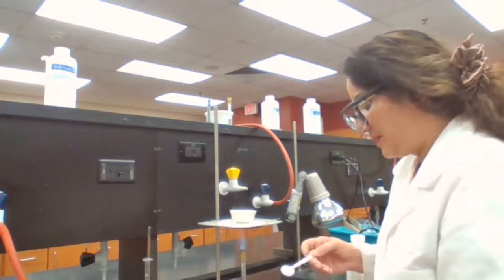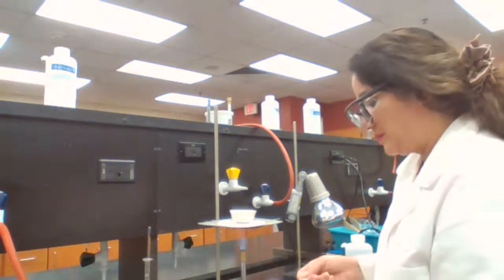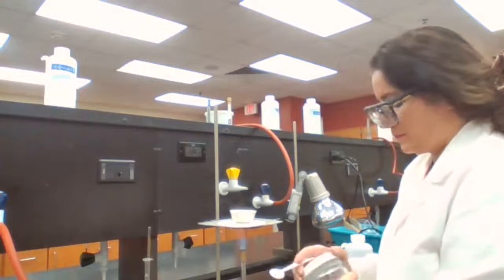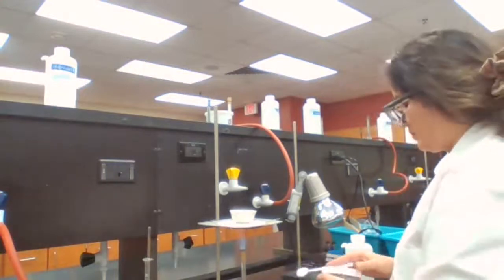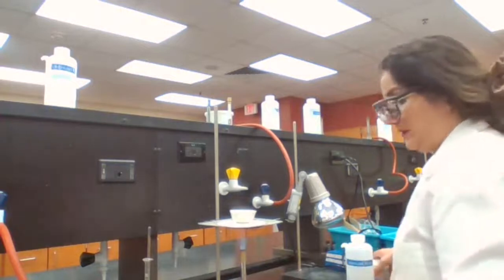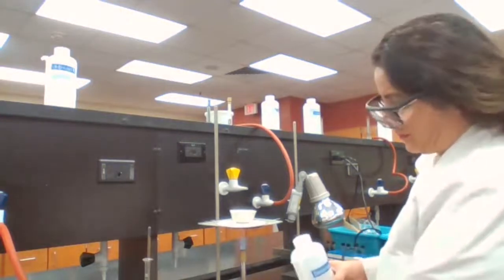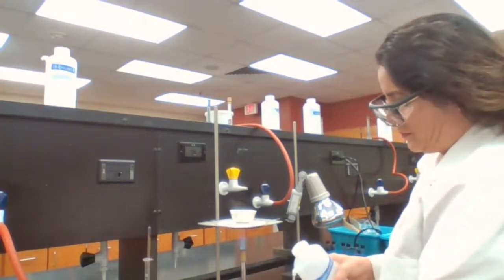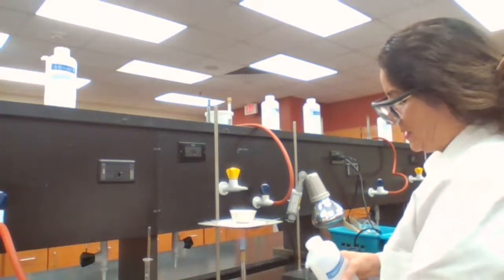When I was recording experiment 2, I missed it, so I'm going to have to perform that experiment today. Getting this ready.